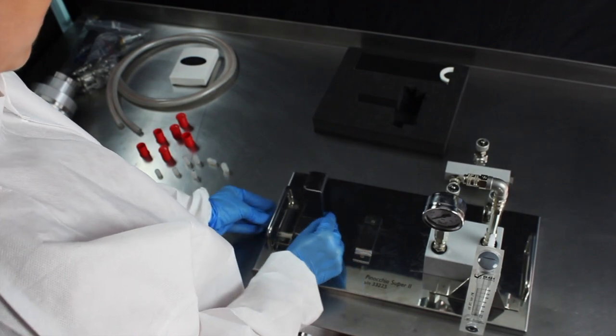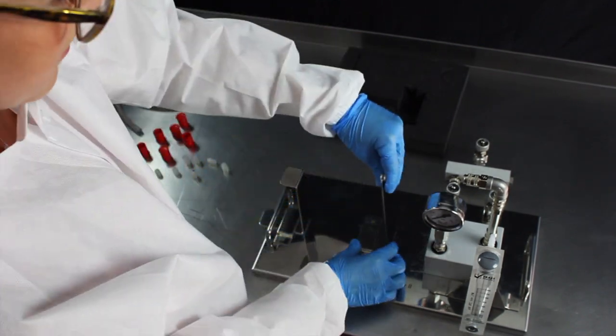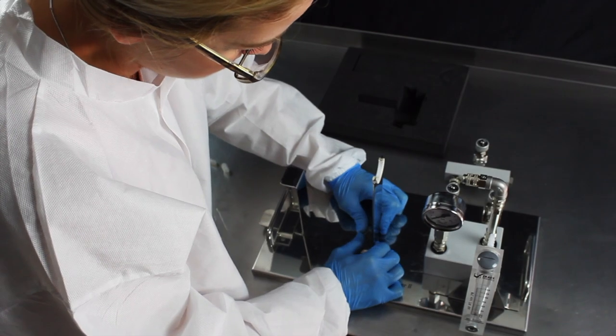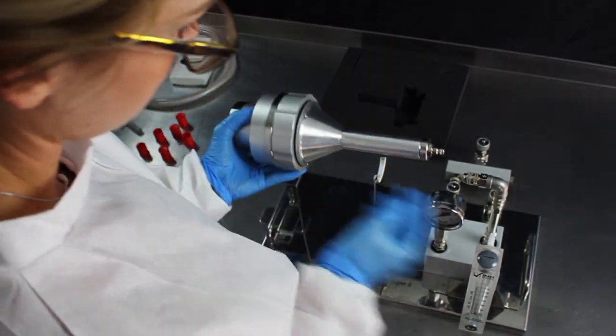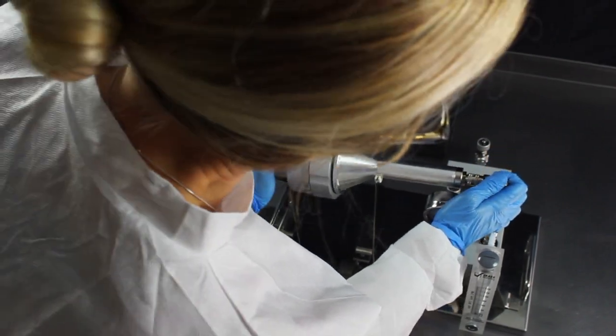Slide the funnel support onto the base. Position the funnel on its support and secure it to the air outlet labeled P in the Pinocchio diagram.